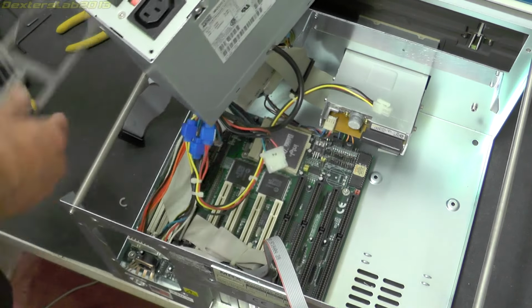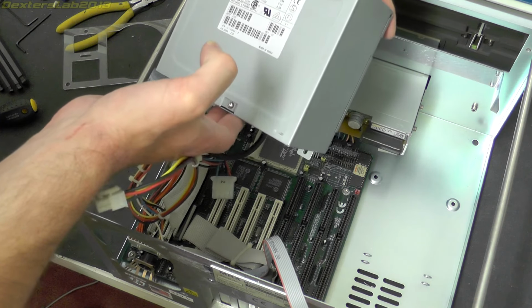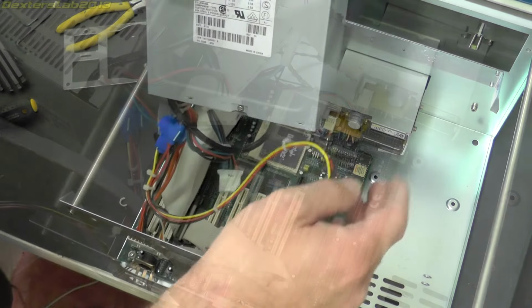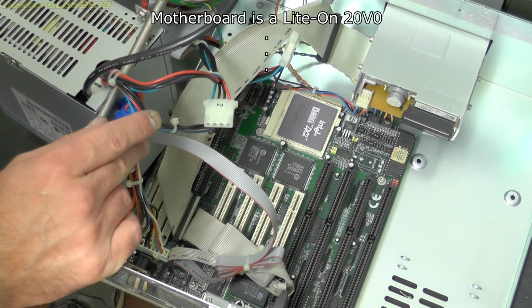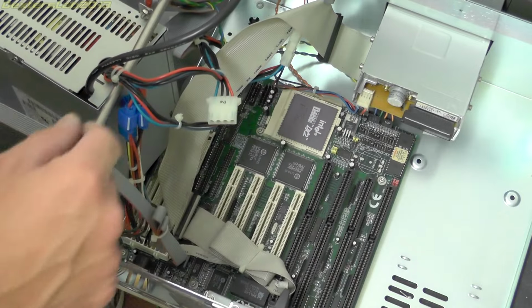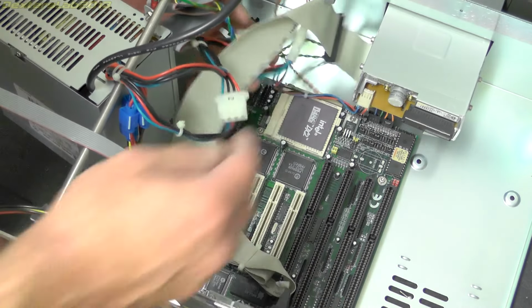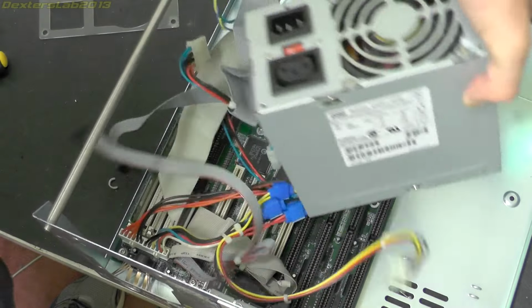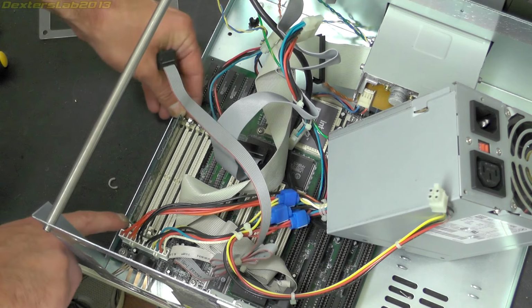Little plastic cover there. So the power supply is obviously just a standard PC power supply. It's an Astec one though, so a fairly decent make. The motherboard, yeah, I can't see any branding on that PCB at all, so I'm not sure who makes it. The chipset is a UMC North Bridge and South Bridge. We've got AMI BIOS over there. We've got a Dallas clock chip down in there, so all pretty old school. Just down here underneath the cables we have the old cache RAM as you used to have it, and just here we have the old school 72 pin SIMMs. There's only one installed.